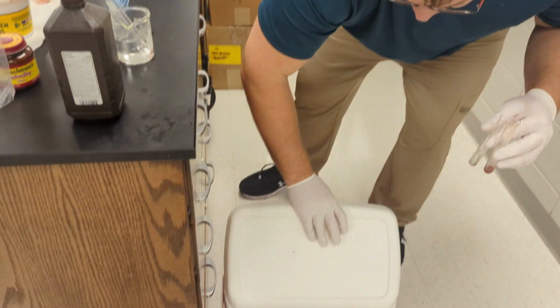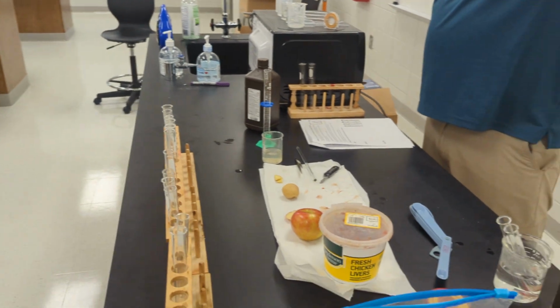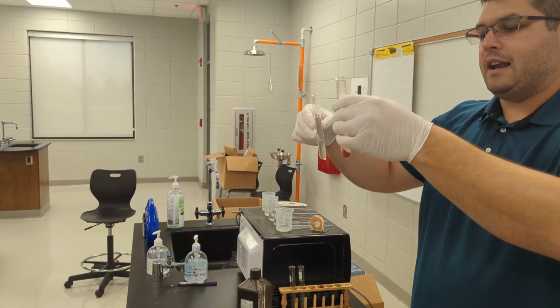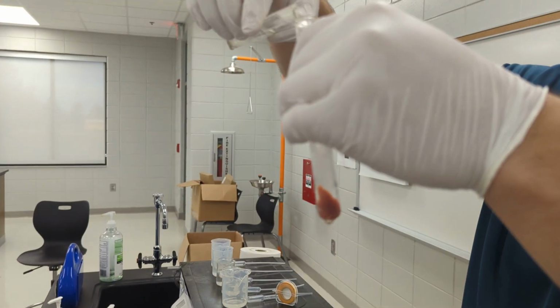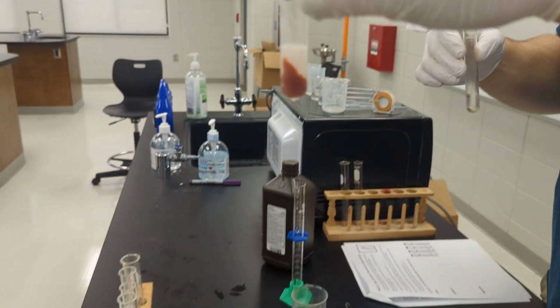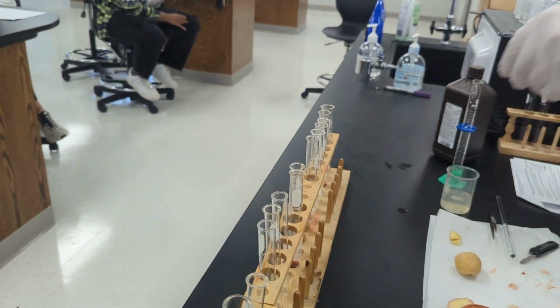I've got liver that has been chilling on ice in here, as well as peroxide. They're both cold. So the liver itself is cold. You can see the frost and the condensation. And the peroxide is also cold. So cold liver and cold peroxide. It could just be regular ice. Ooh, and bubbly.